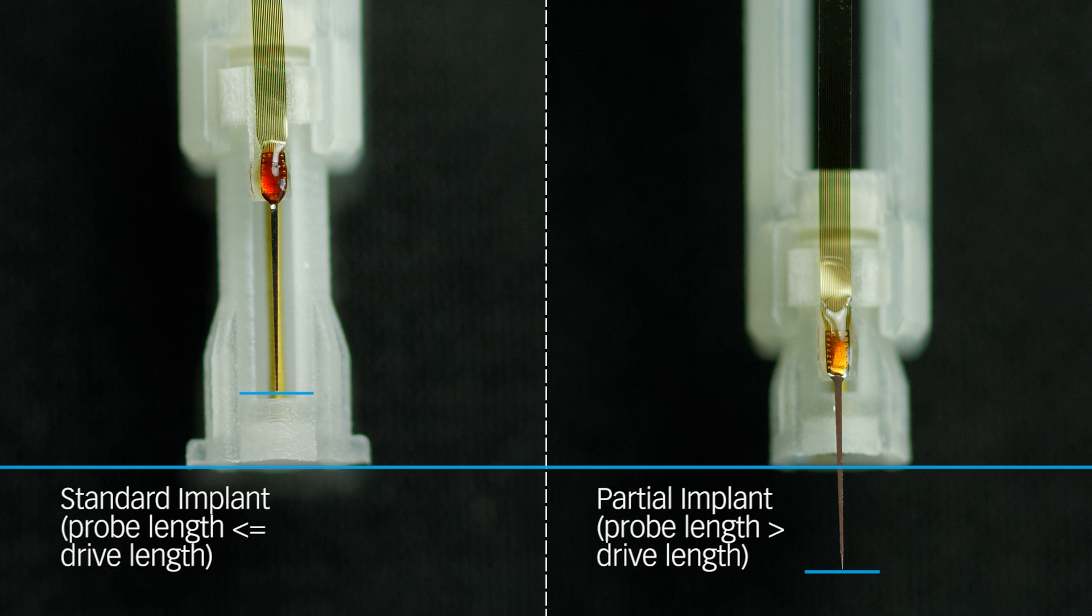If your probe length is shorter than the drive length, you will perform a standard implant, where the O-Drive is used for both the initial penetration and fine-tuning of the electrode array.